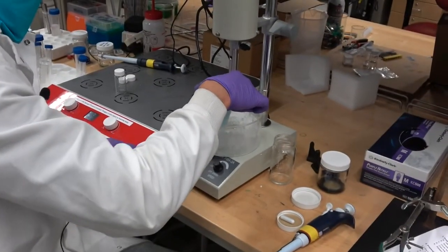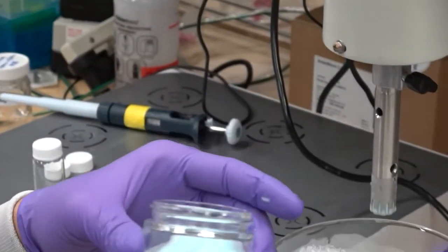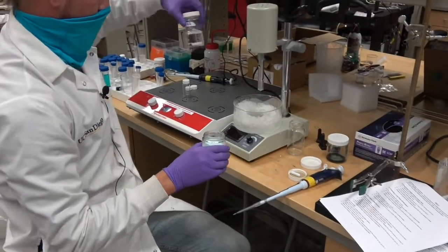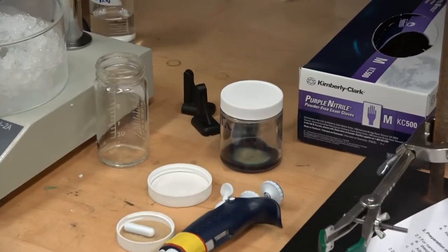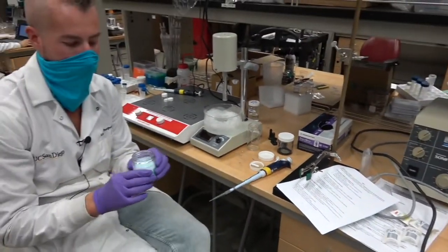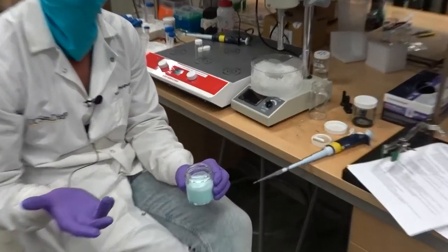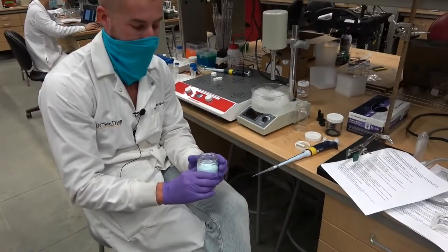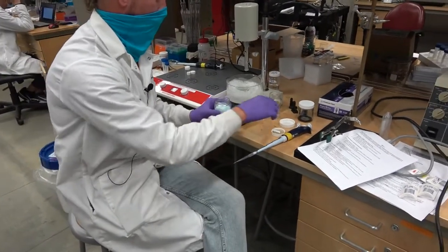Okay. So obviously you can appreciate this looks pretty different than the oil phase that we dripped in or the water phase that we started with, right? So the next thing that we would do is we would slowly stir this in a hood in order to allow the extra dichloromethane to evaporate, okay? Leaving particles.